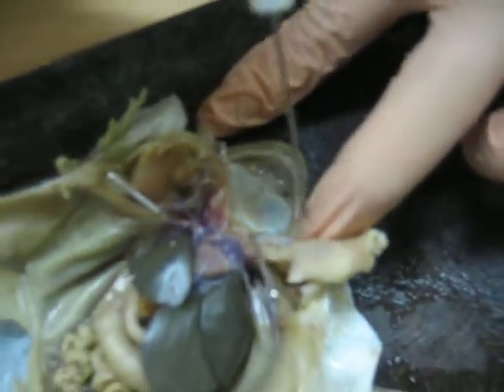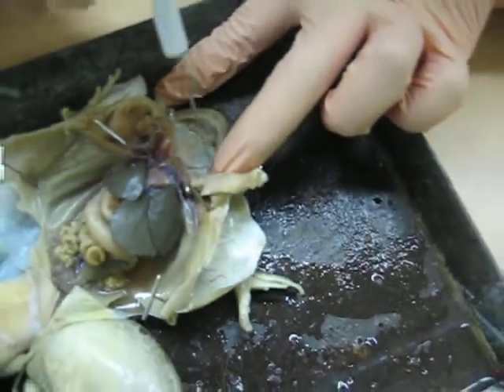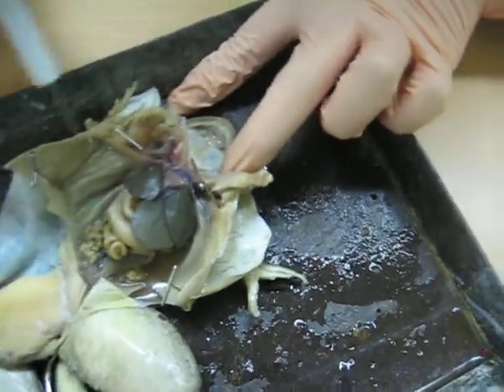Tongue, right here. Cut him up. Stomach. Stomach.